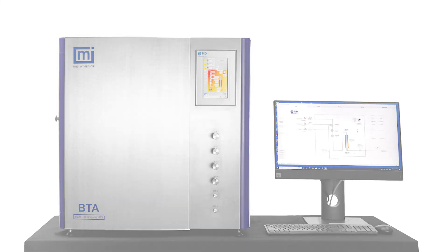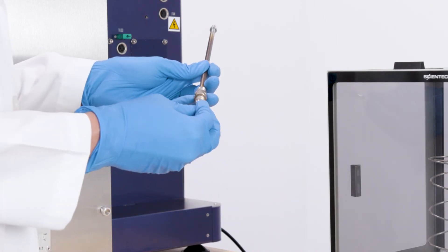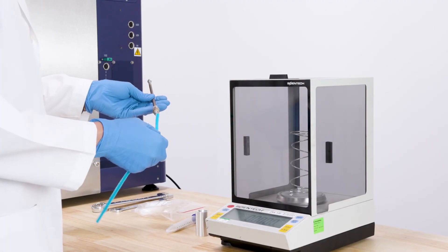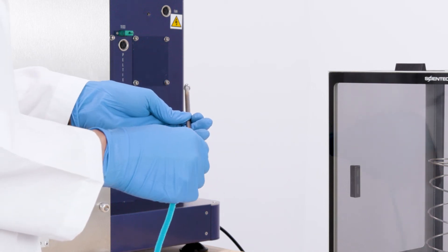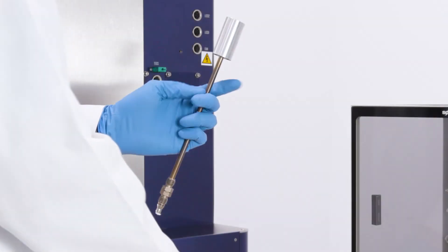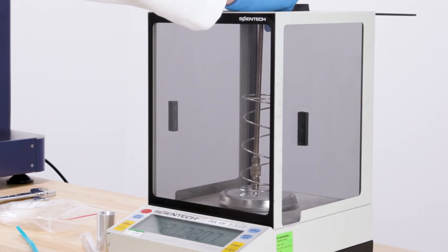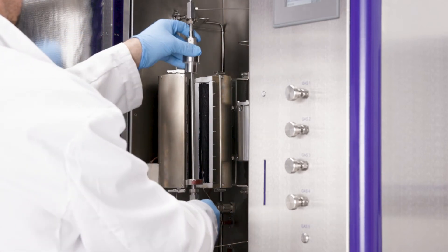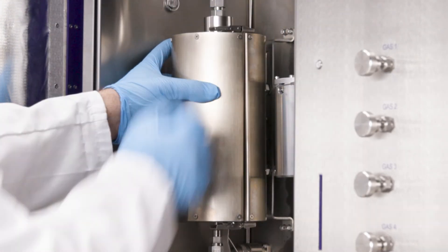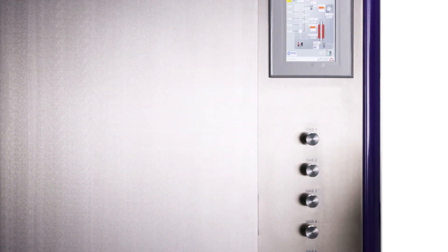Next, we'll move to the demo of loading and running a sample. To prepare a sample column for analysis, first take an empty sample column, take a pinch of quartz wool and load it into the sample column. Push it up at least two to three inches into the sample column such that it lies in the ideal heating zone of the furnace. Weigh the empty sample column and record the weight. Then load your sample into the top of the sample column and once again record the weight. Take your sample column to the BTA, screw the sample column into the furnace. Next, close the furnace and secure the clips at the top and bottom. Then close the door to the BTA. Now your sample is ready to begin analysis.